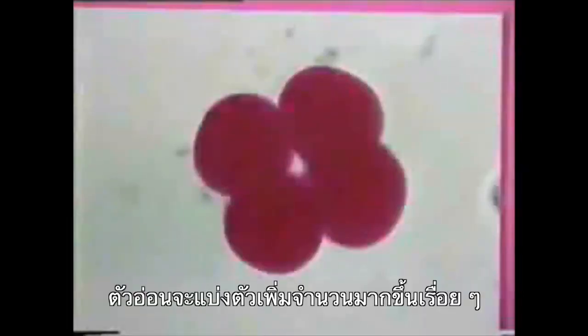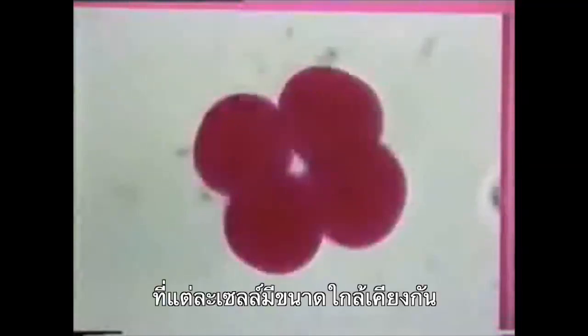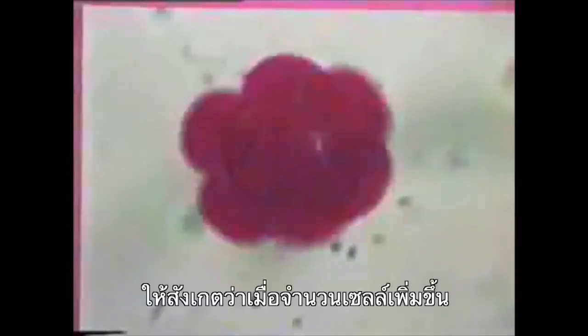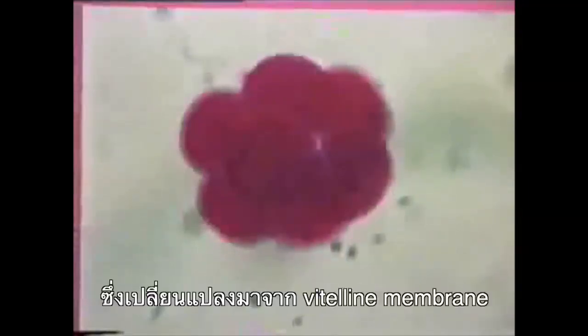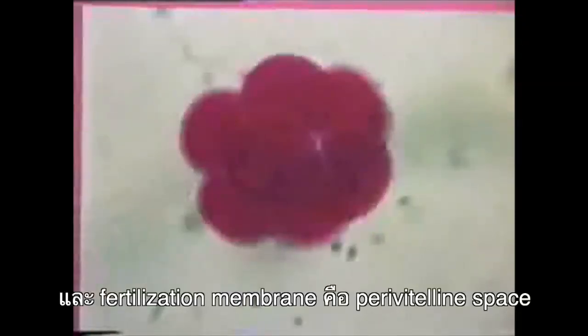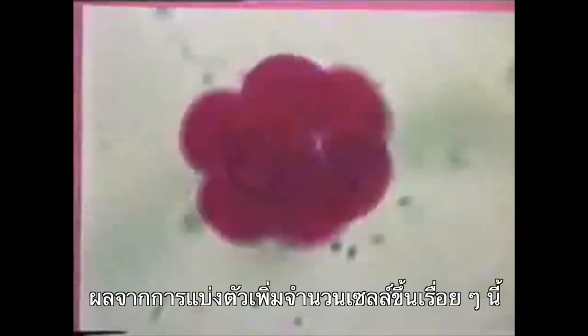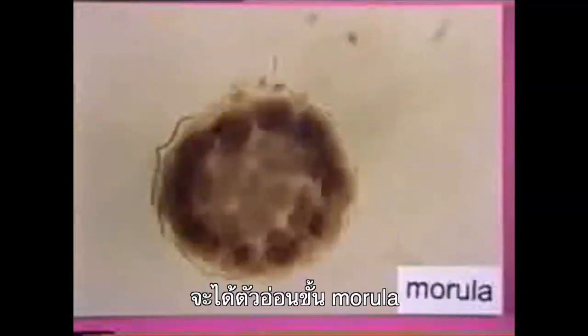Cell division continues and the number of cells increases. Here we see a four-cell embryo. Notice the approximately equal size of the cells in this embryo. Here is an eight-cell embryo. Notice that as the number of cells increases, the size of the cells gets smaller. The outermost clear layer covering the embryo is called the fertilization membrane, which develops from the vitelline membrane. There is a space between the cell membrane and the fertilization membrane called the perivitelline space.